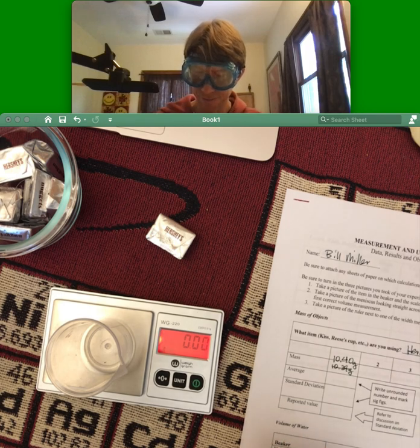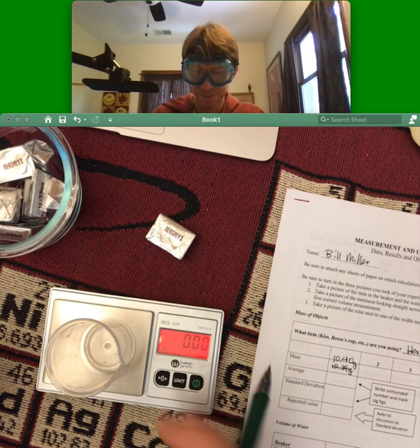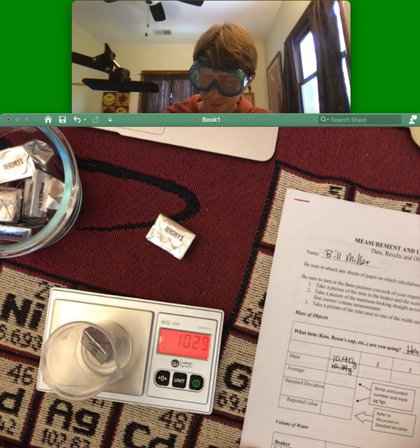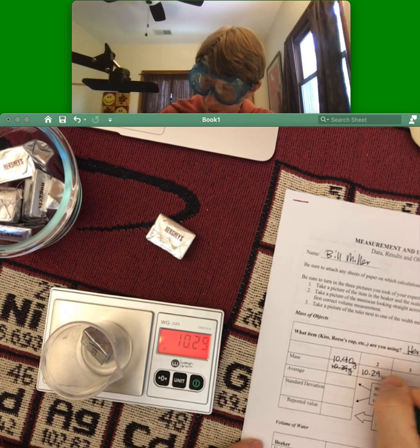Goes back to zero. Little dot appears. Put another one in. Sounds good. 10.29 grams.